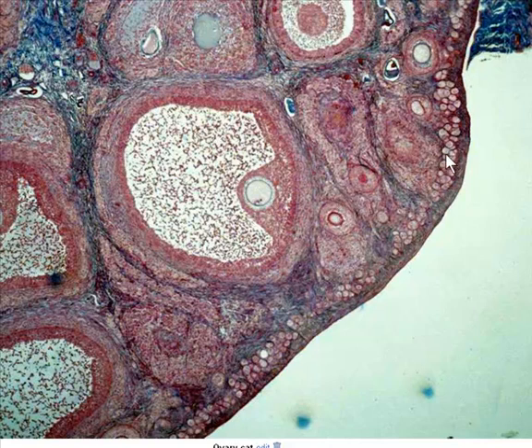We see the primordial follicles through here, all of these small ones. Here's primary follicles here. And these are good secondary ones here with the fluid-filled antrum. There's the oocyte. There's the oocyte there. You'll also see what are called atretic follicles, those that did not complete the developmental sequence and actually have a little spot of blood inside of them. We see that here and over here.